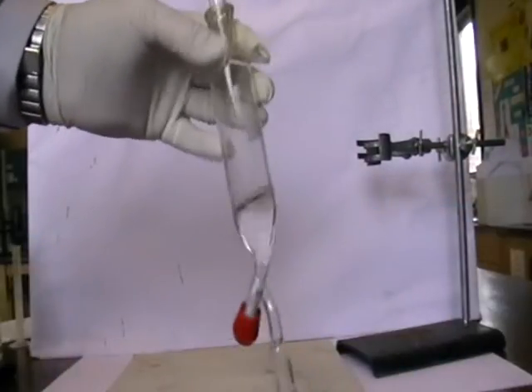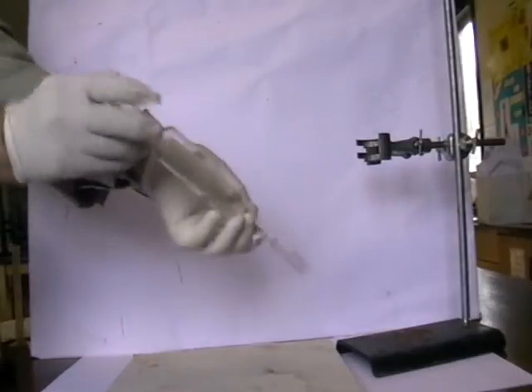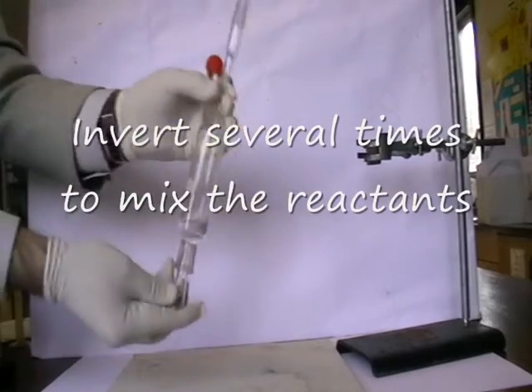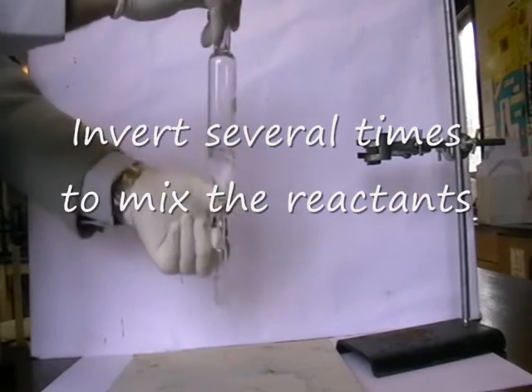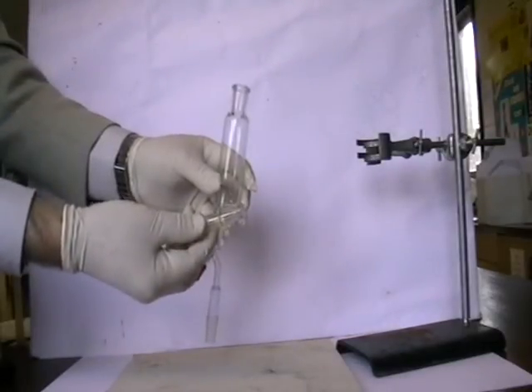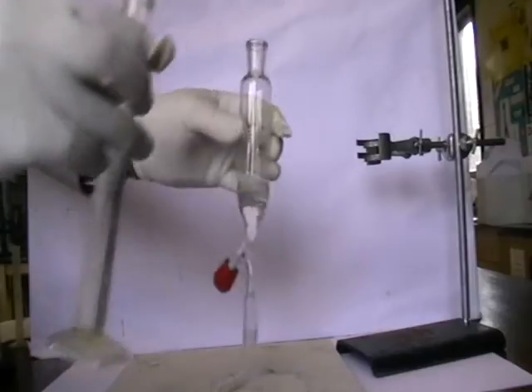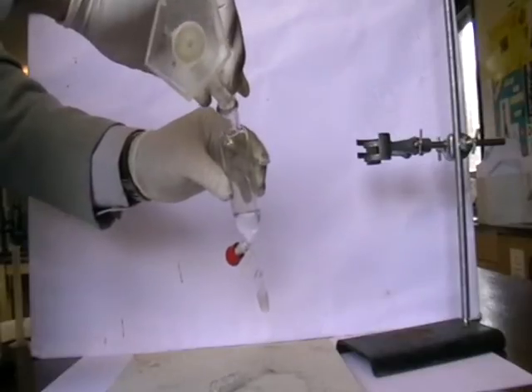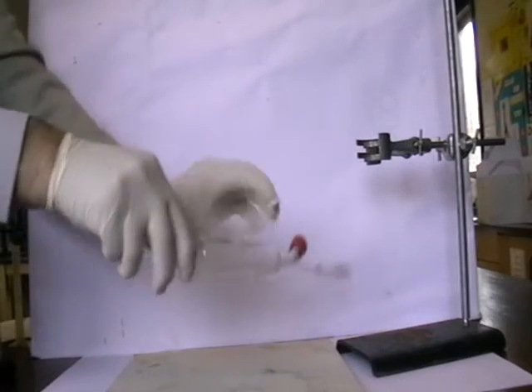I've added my first 3 cubic centimeters of concentrated hydrochloric acid to the alcohol. I hold the stopper, invert this a few times, just to make sure that the two reactants are mixing and reacting. There will be some acid on the stopper, so I'm setting it down on a heatproof mat to protect the bench. I'm ready then to add the next 3 cubic centimeters approximately — if I tilt it on its side, I can let it run down the edge slowly. When I repeat this process, I turn it on its side.